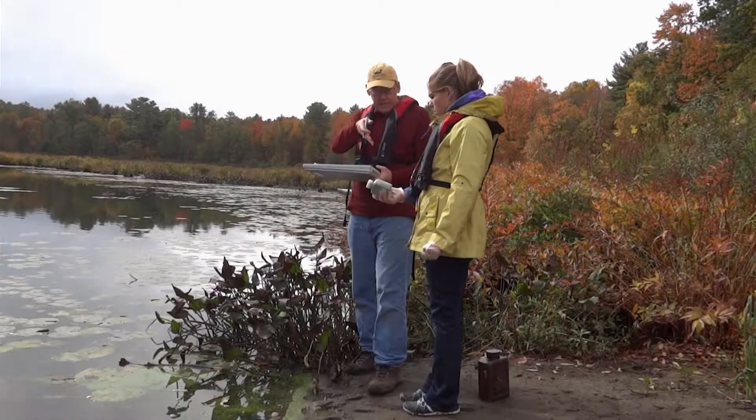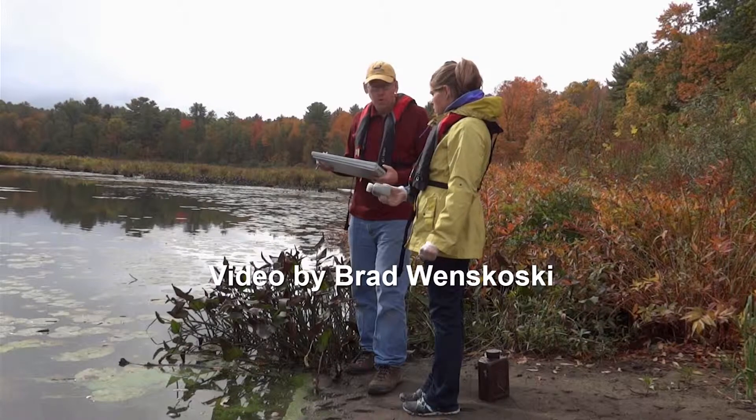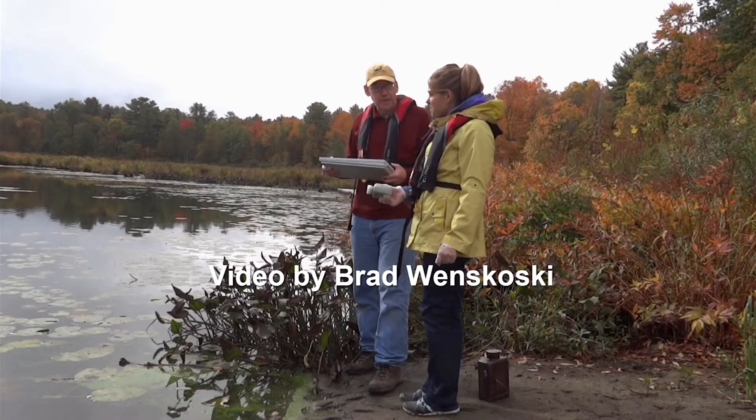You'll dispose of the gloves, take this algae bloom bottle, put it in the small cooler for SUNY ESF, add the sheet you've just filled out, and send that off to the laboratory. Thanks for collecting the sample.